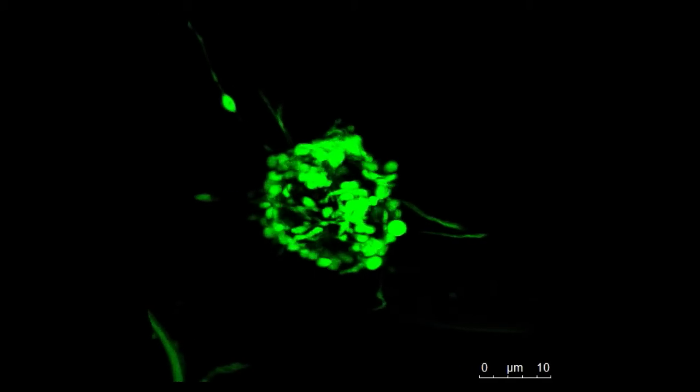Finally, here's a video of the same tobacco cells showing the three-dimensional arrangement of the plastids. They engulf the nucleus during interphase.